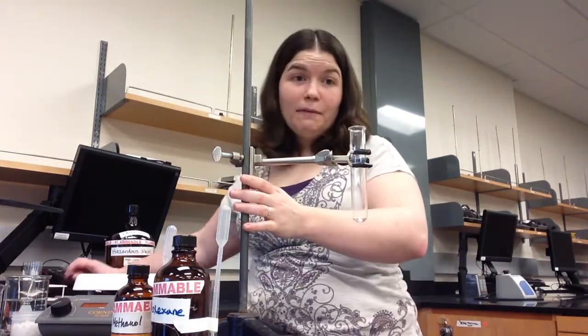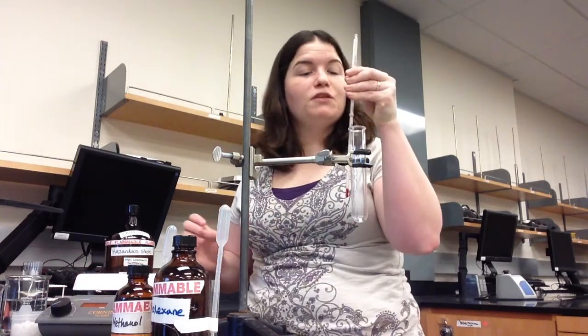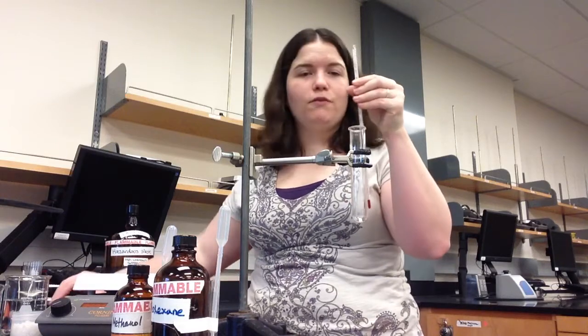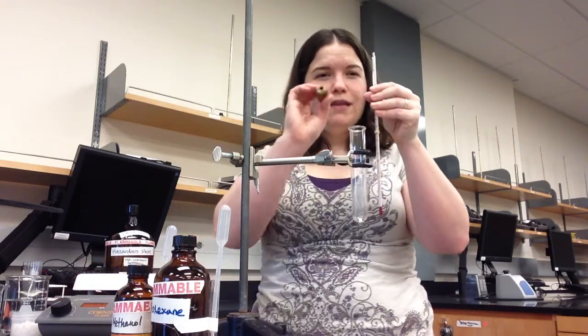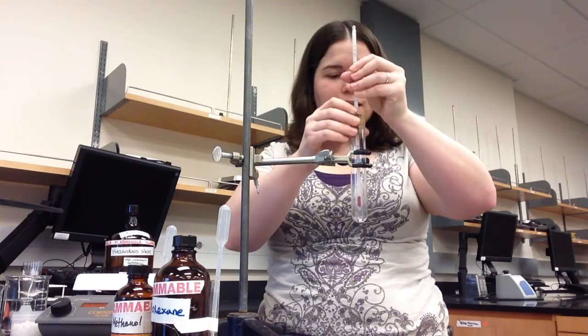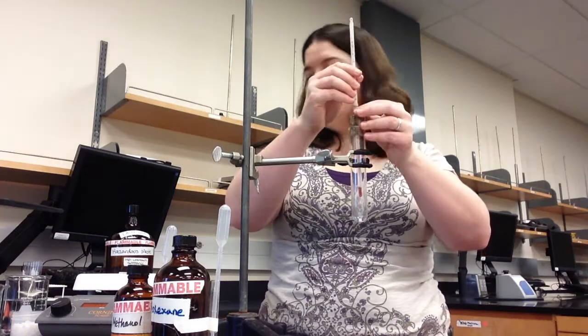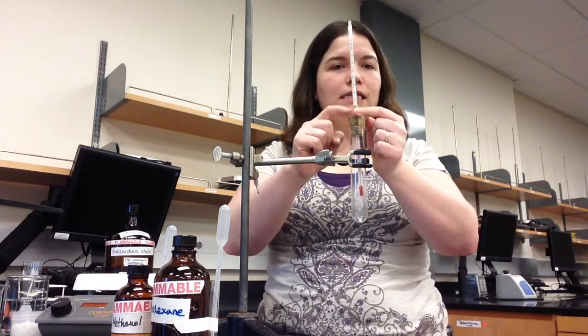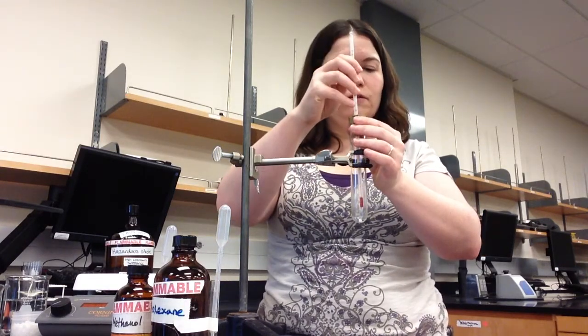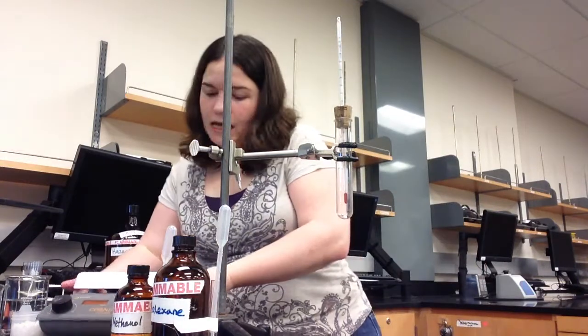Since you need to determine the temperature of the boiling, you will need a thermometer out of your lab drawer. It measures in degrees Celsius. Make sure you use the correct number of significant figures. You'll then need a ventilated cork to hold the thermometer in the test tube above the level of the liquid. If your thermometer falls through, you can use a little rubber band at the top of the thermometer to hold it in the cork. We need to heat the unknown liquid, and today we're going to make a hot water bath using a hot plate.